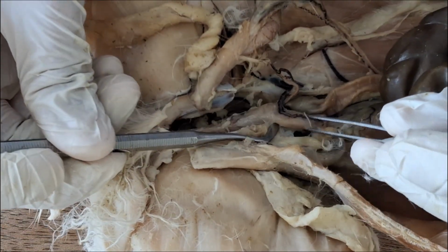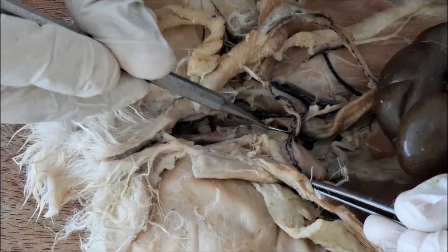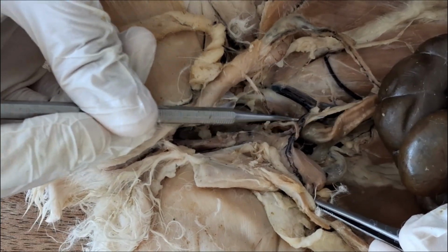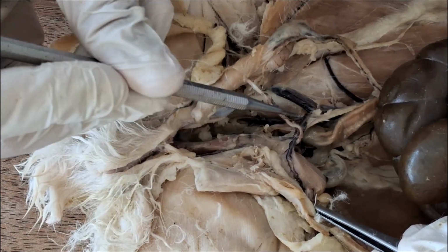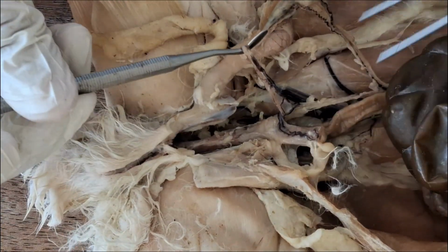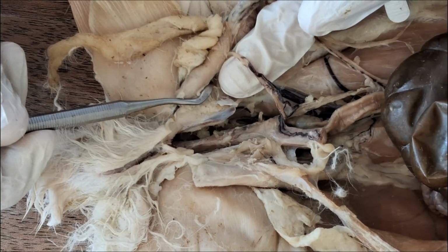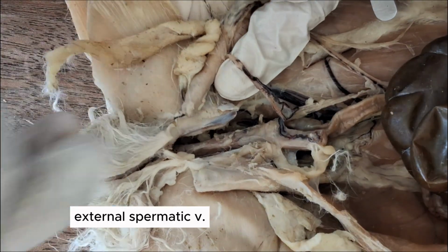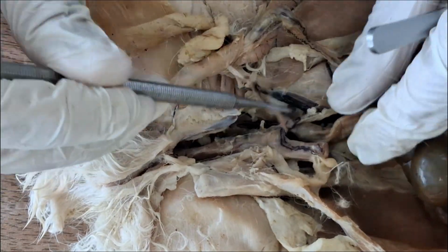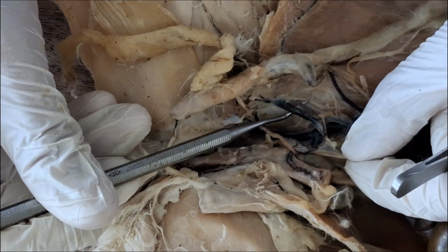This is the vesical vein. It drains blood from the bladder. External iliac. Vesical vein. The vesical vein also gives rise to the external spermatic. External spermatic vein, vesical vein, and this one is the external iliac.